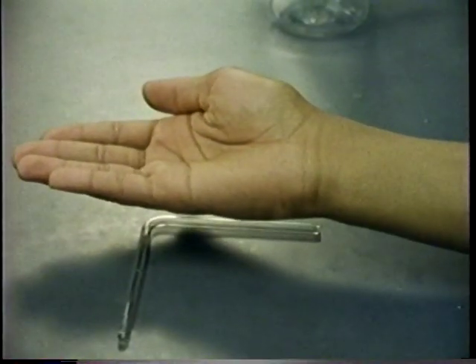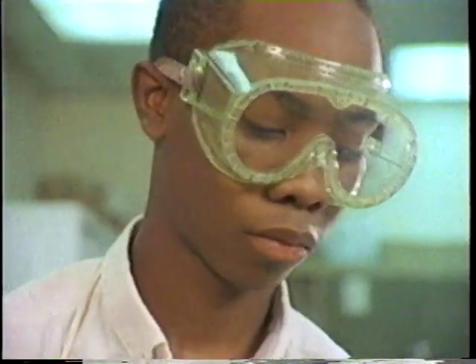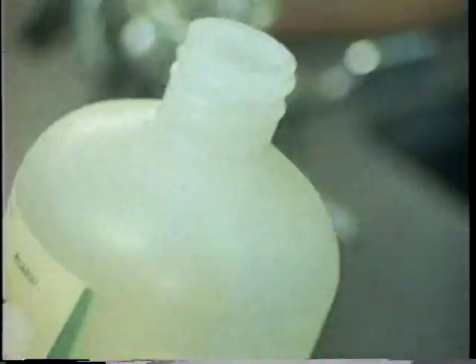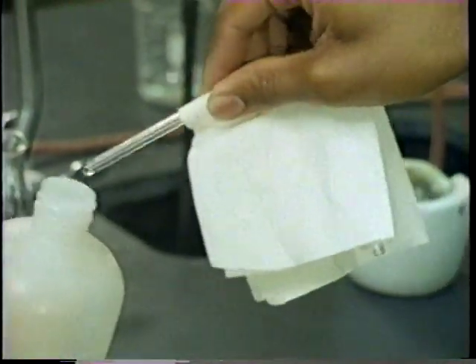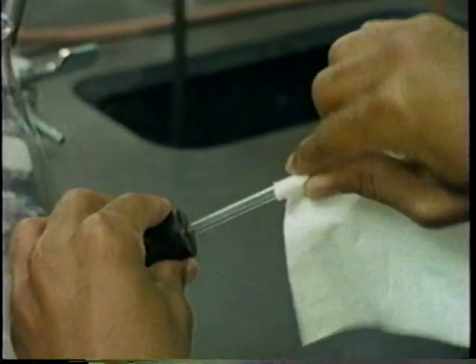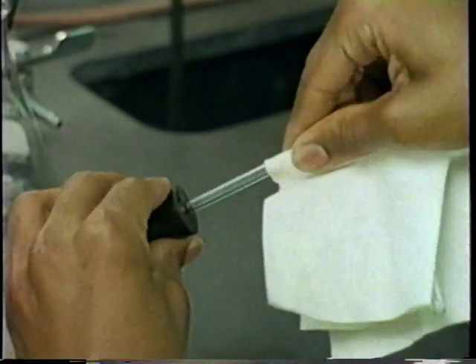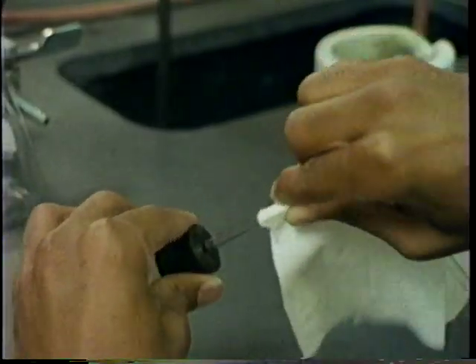What'd you do with the tubing? I was setting up an experiment, and I needed to run it into a rubber stopper. Sounds like that could get tricky. Yeah, it can be. What you have to do is lubricate it first. Glycerin is best. Then you use a towel to protect your hand and insert the tube slowly using a rotating motion. You gotta be real careful. The stuff breaks easy.